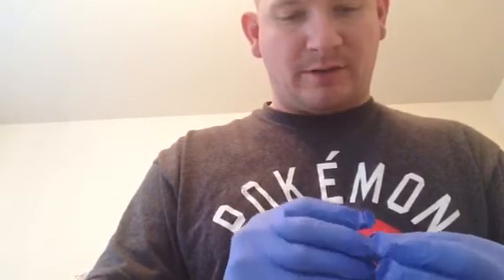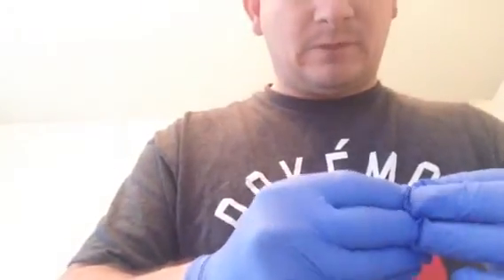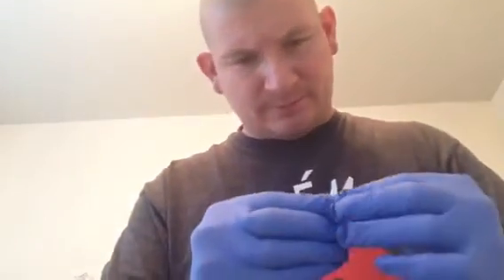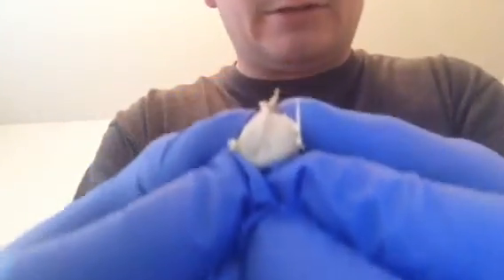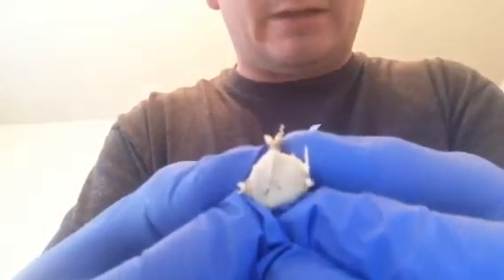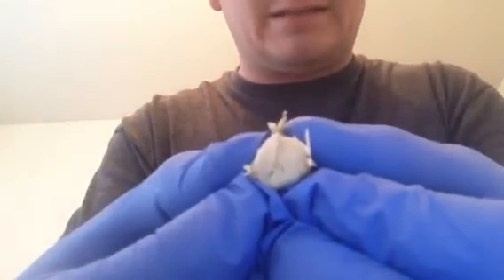And although the spinal cord, I thought it would be more prominent, the color changes from gray to white when you transect it. Again, hold on a second. See if I can piece this back together. As you can see, the butterfly region of it isn't quite as obvious when you get it back together, but you can see it there. And it's more of a textural change than anything else. Gray matter would be on the inside of the spinal cord, white matter would be on the outside.